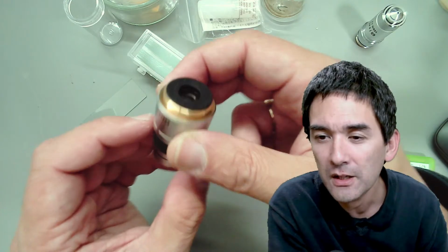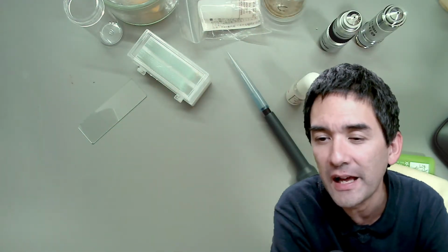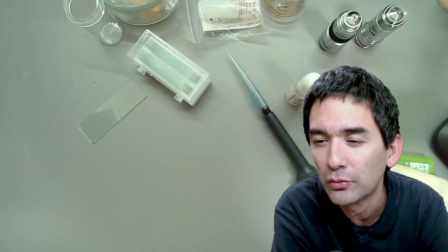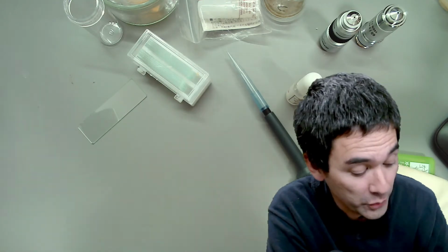Another interesting comment: I clean microscopes for physicians and veterinarians. I have a veterinarian applying immersion oil directly to a dried blood smear. Have you heard of doing that? Yes. And I'm going to show you this.